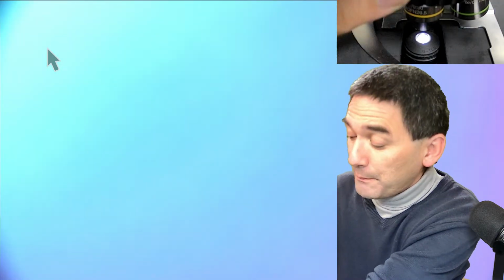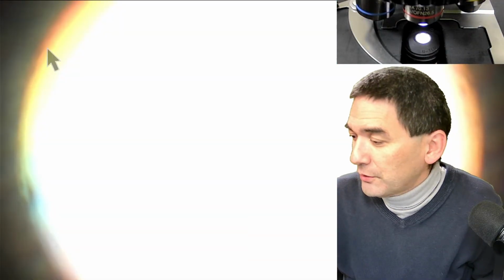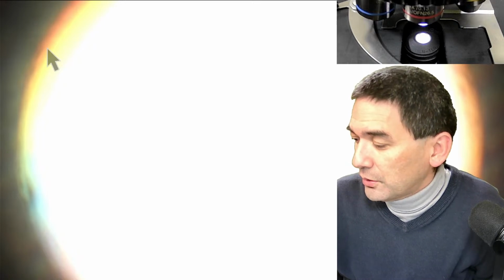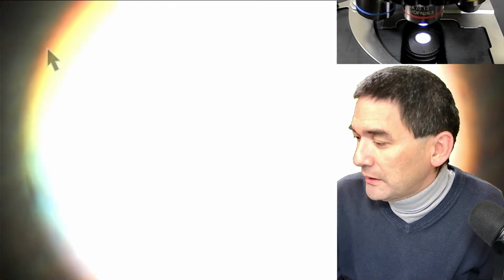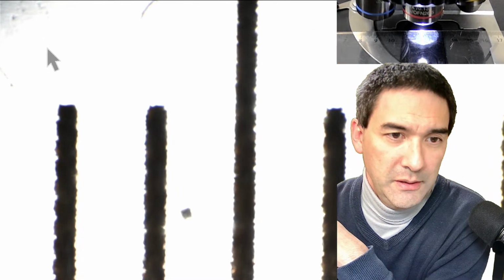I prepared something already because I cannot show it to you on the monitor, so I prepared it on paper. Let me quickly close this here, and let's put this out here. And I'm going to put the ruler now directly under my low power objective. Okay, so, and you might want to focus a little bit.